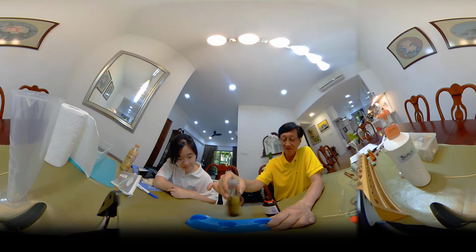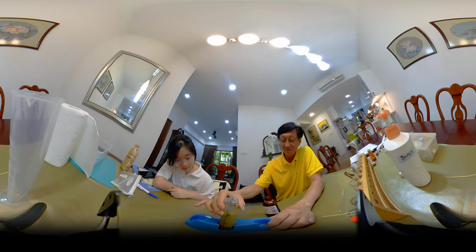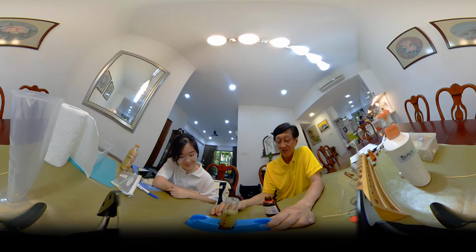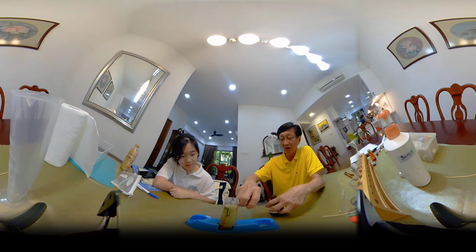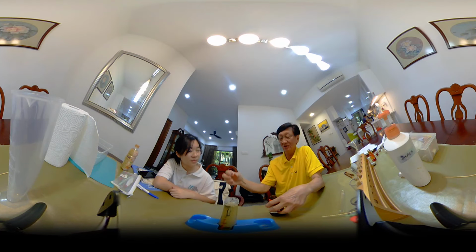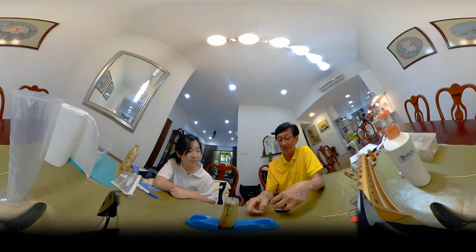Shake it around. It doesn't come out. Sometimes when it's very concentrated, the whole bubble will rise above like that. Or it's rising right now.